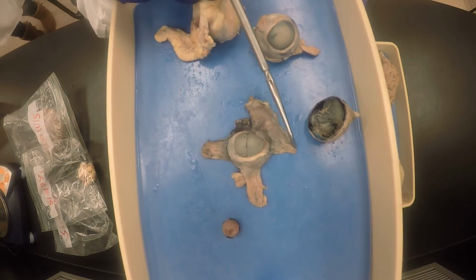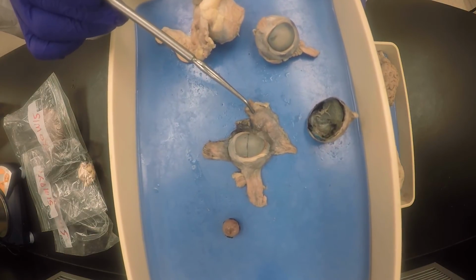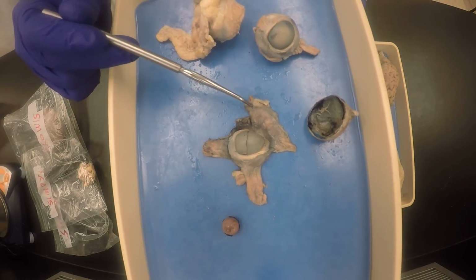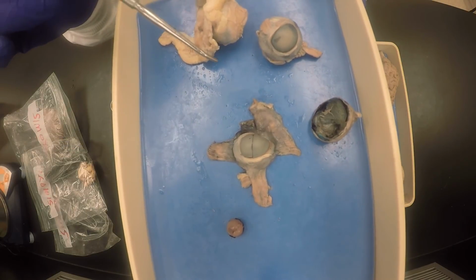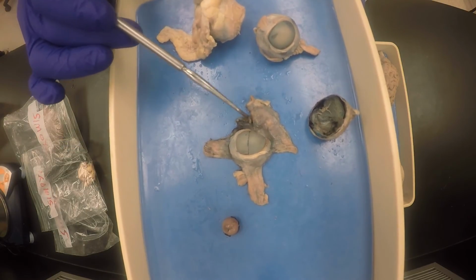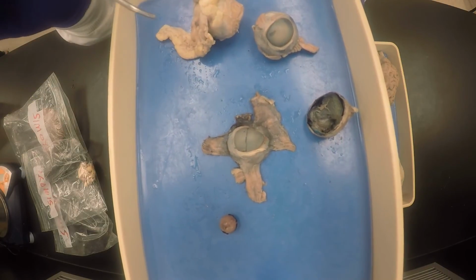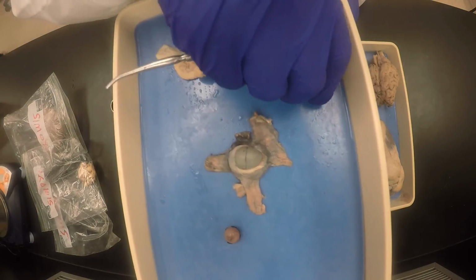So this will be the lateral rectus, and this will be the inferior oblique, sorry, inferior oblique, and then this is the lateral rectus. The inferior rectus is this one, the small one right here. So this is the inferior rectus. And then of course the retractor bulbi will be right here.